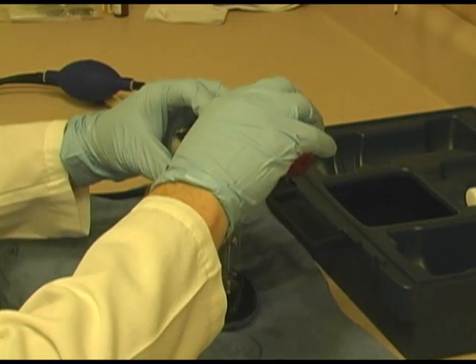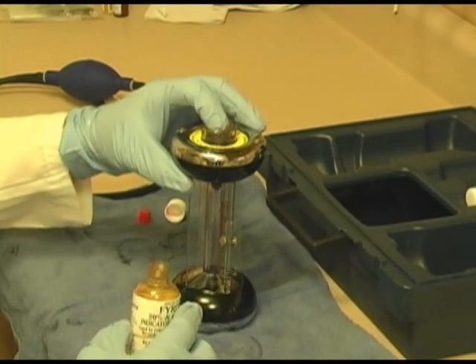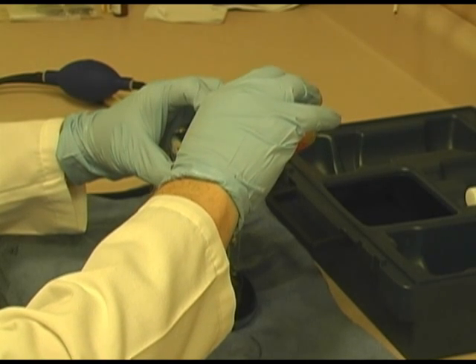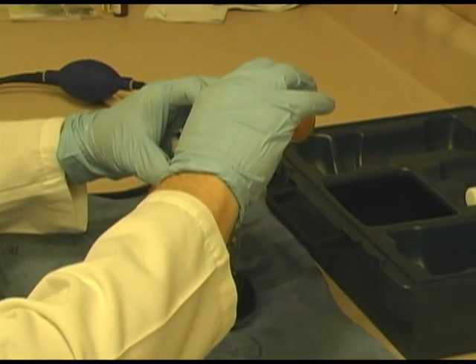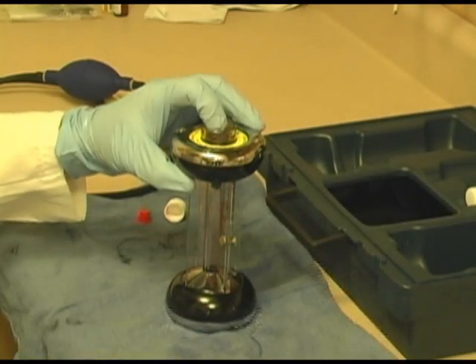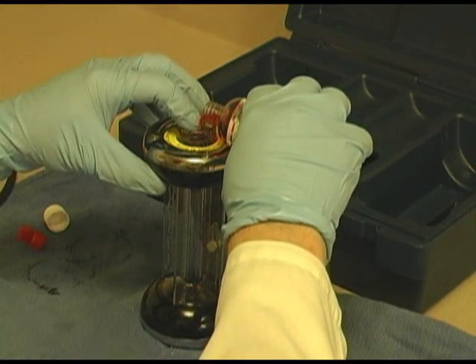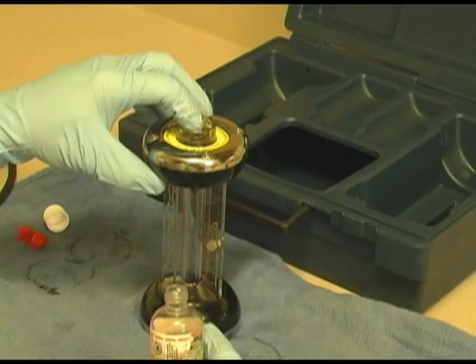I'm just thinking to myself, I'm wondering if that's why sometimes I get that salt buildup. When you get that salt buildup and you have trouble pushing this in, just take the top apart and clean it with distilled water. I do it somewhat routinely. I have to think about that. Essentially you need to fill it up full enough so that when you zero it, you have enough range for your scale. These are used bottles, ones I've used for other instruments, so I'm going to add a little more. And again, I might even rethink how I'm adding this for future reference, because maybe this is why I get salt in them all the time.